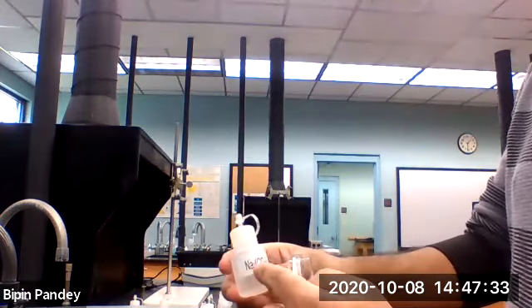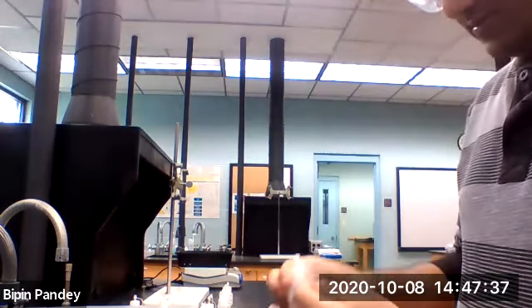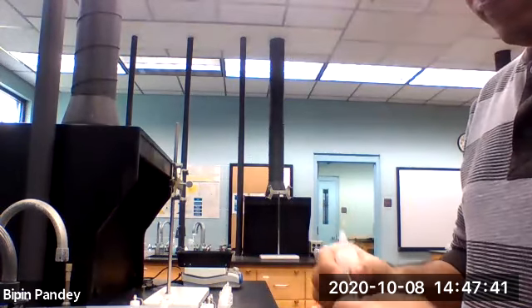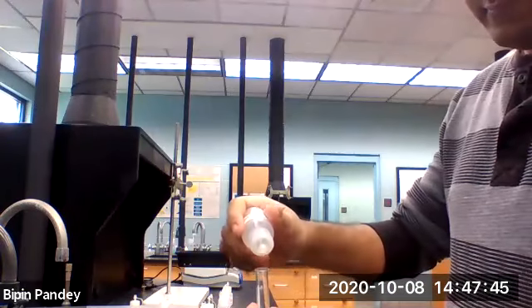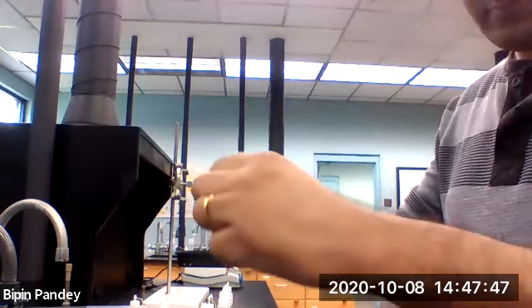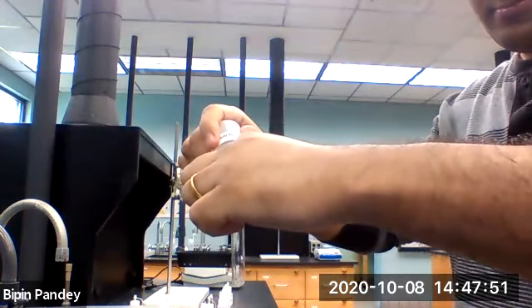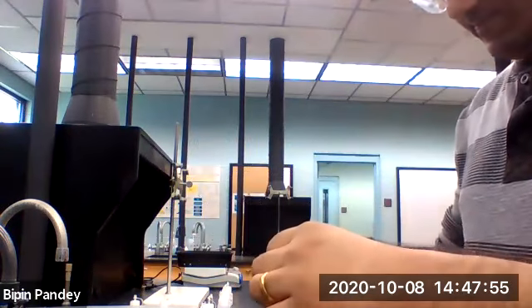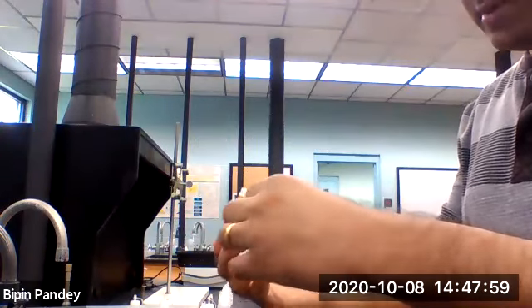I use sodium carbonate. 5 drops of calcium chloride, 5 drops of sodium carbonate.